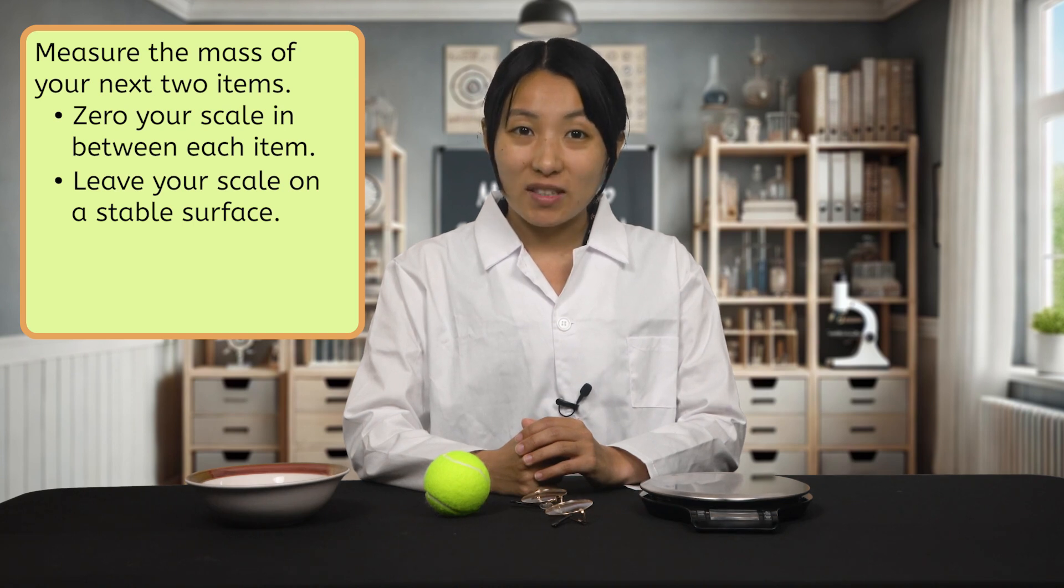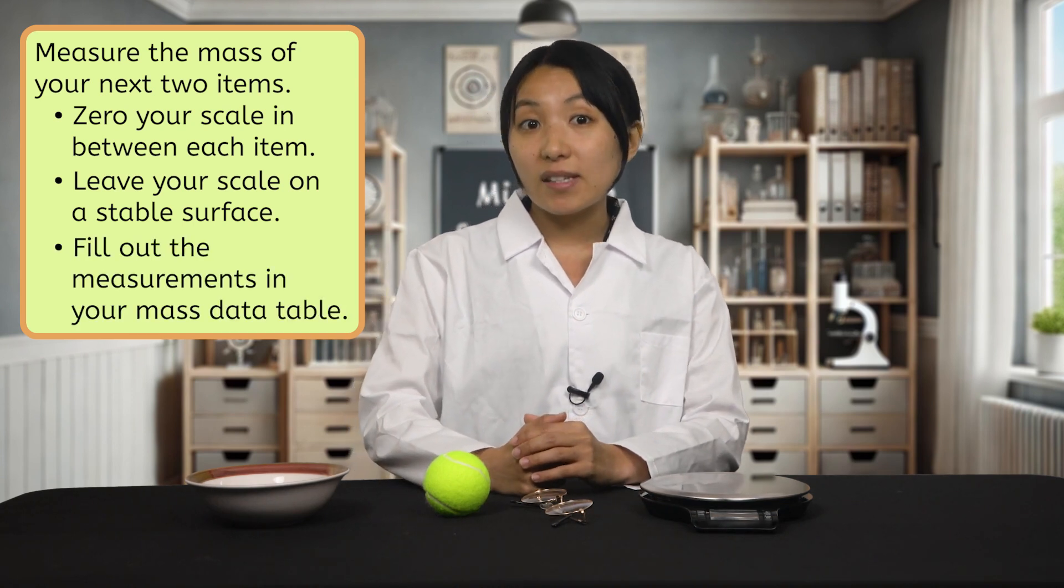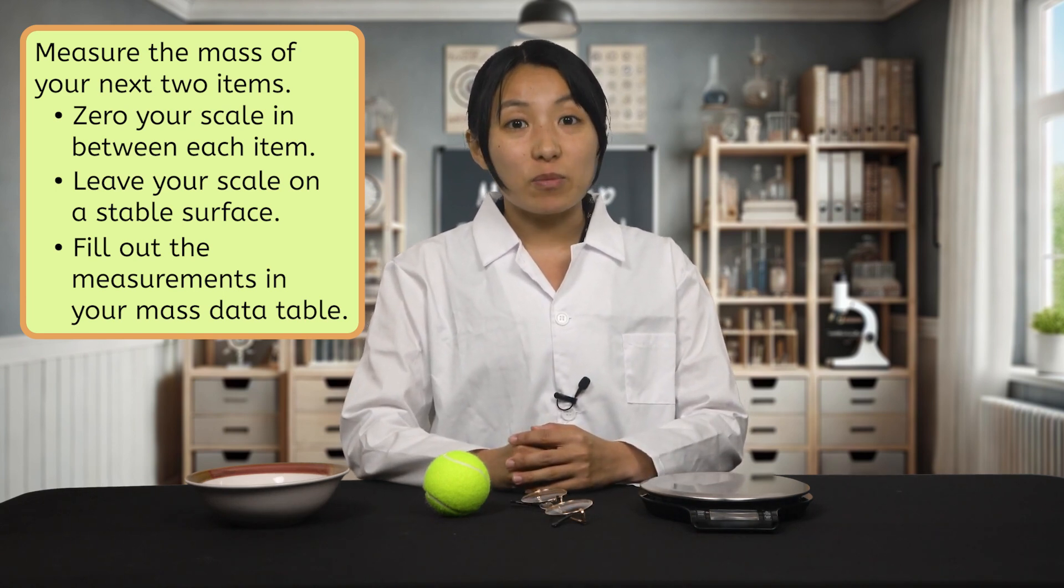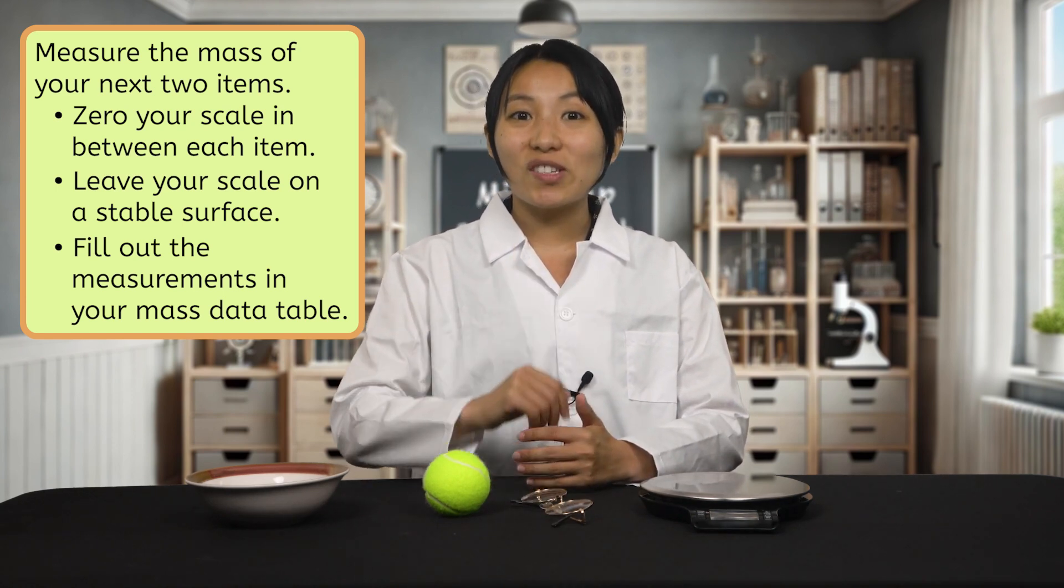As you complete each measurement, fill out the measurements in your mass data table in your interactive lab notes. When you record your measurements, make sure to include the units you used.